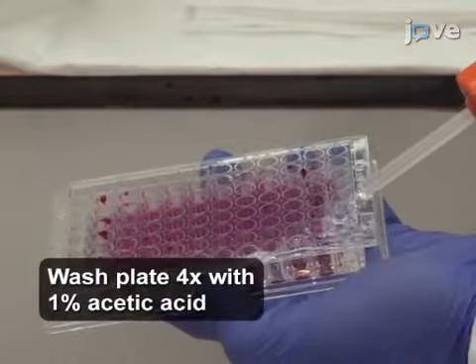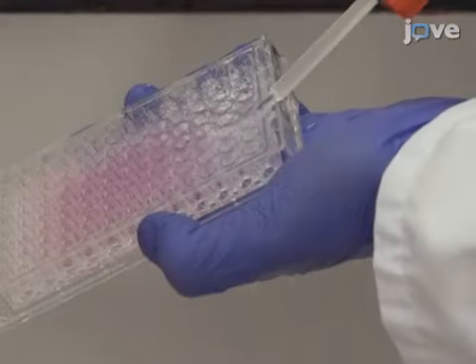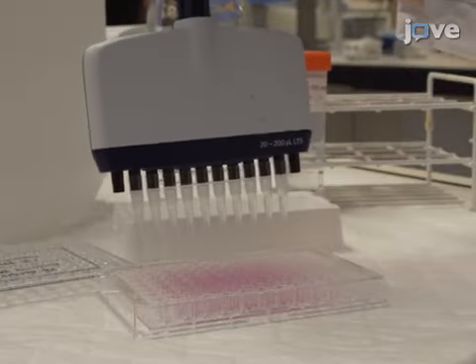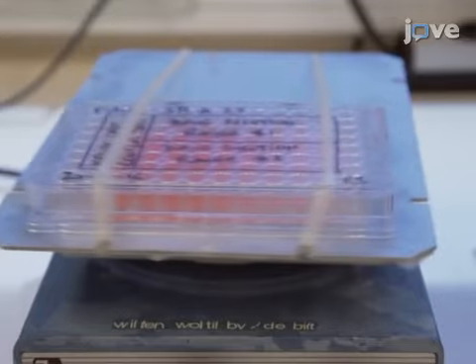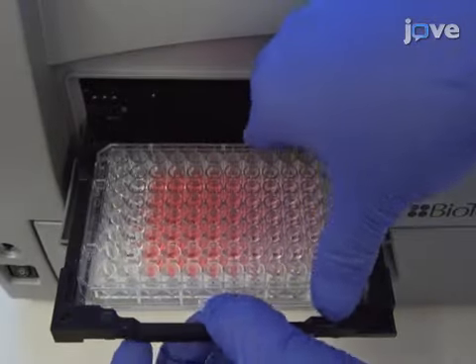After washing the plate 4 times with 1% acetic acid, empty the plate and let it dry at room temperature. Add 150 microliters of tris solution per well by using a multi-channel pipette, and mix for 3 minutes on a plate shaker up to a maximum of 900 shakes per minute. Read the optical density at 540 nanometers.